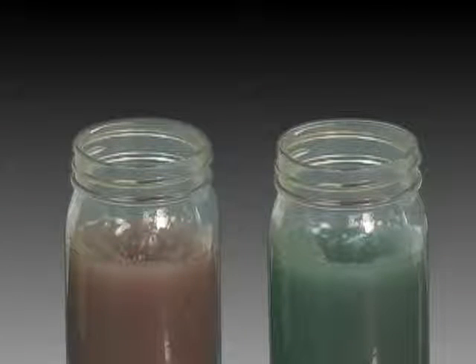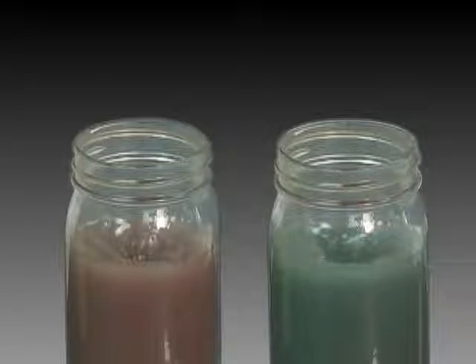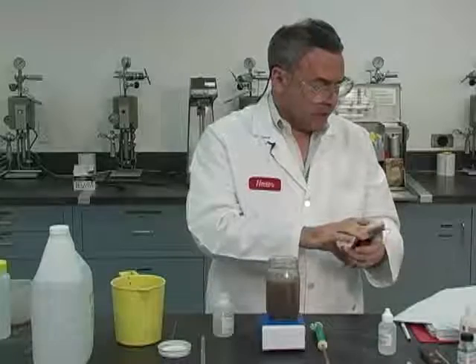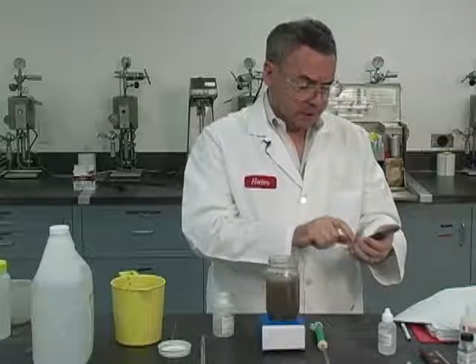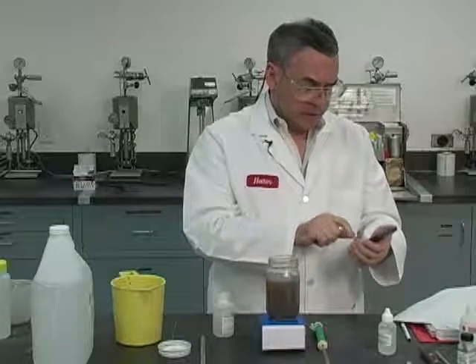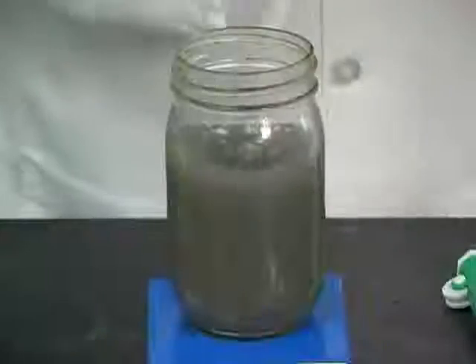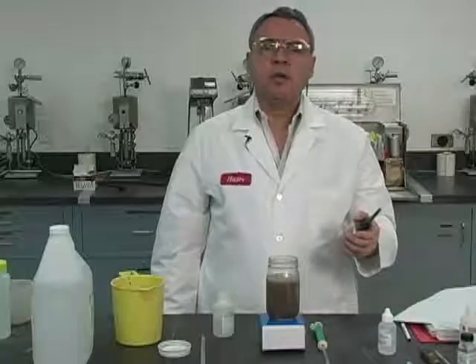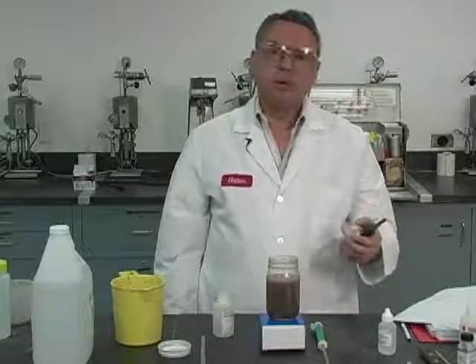So now the measurement: because I was using the 200 EPM calcium buffer solution, I have to calculate 4,000 times 11.4 divided by the size of the sample — remember it was 2 cc's — which comes to 22,800 milligrams of calcium per liter of mud.